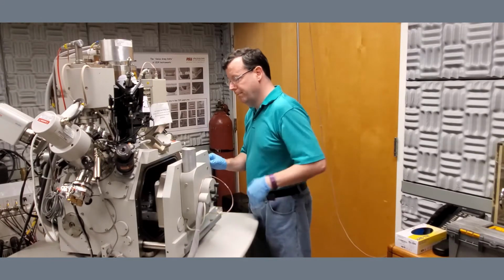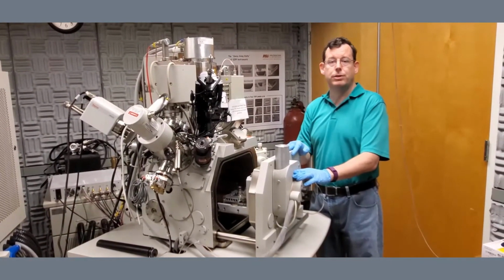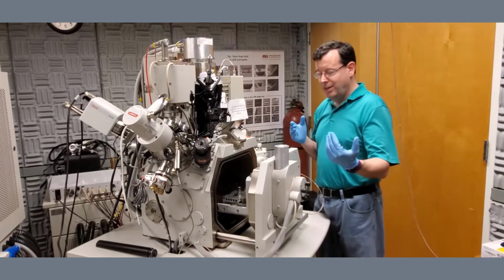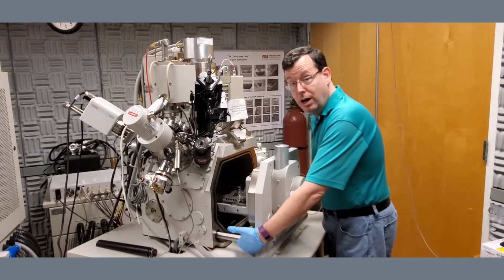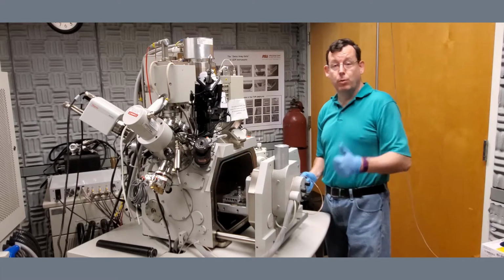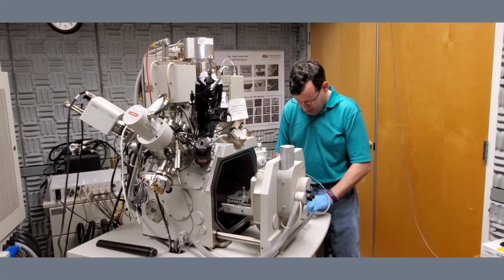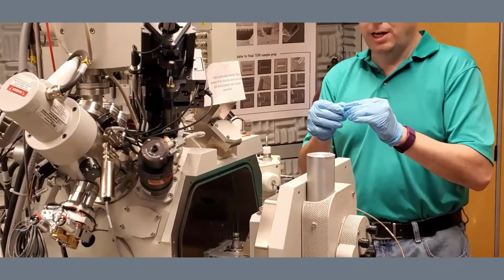So you're going to open it up. And one of the things to be very careful with this system is you do not want to allow the door to slam open. The manufacturer has arranged so that there's 2 glides that the system opens and shuts on. Unfortunately, only one of those glides actually has a stop on it. Here I have my sample. It is a standard pin stub that you can find in almost any catalog.